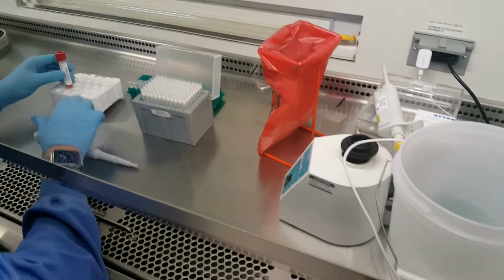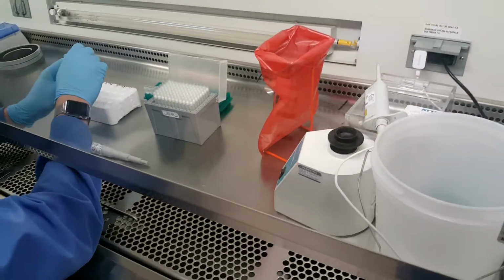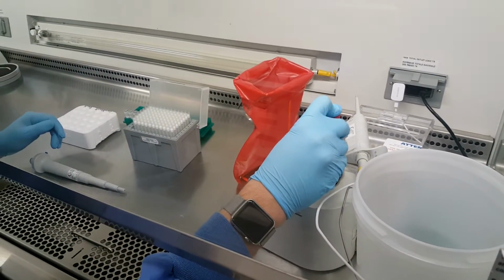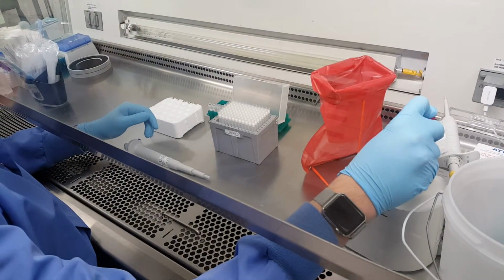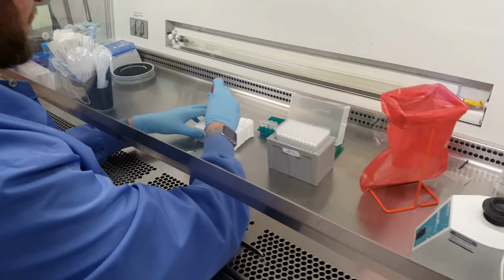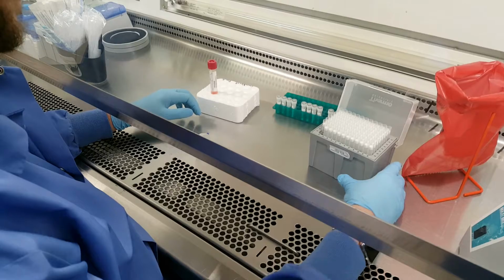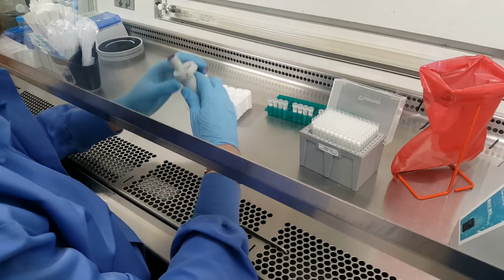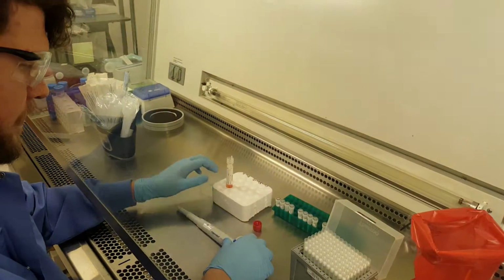So at this point we do need to vortex the tube once again. 10 to 15 seconds. Now, we are not going to wait a minute. Well, I guess we will wait a minute because you need to let the bubbles settle down. So I'm going to stop the video for just a second. Okay, it's been about a minute.